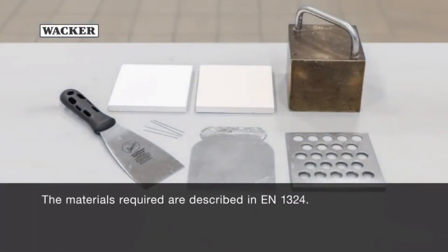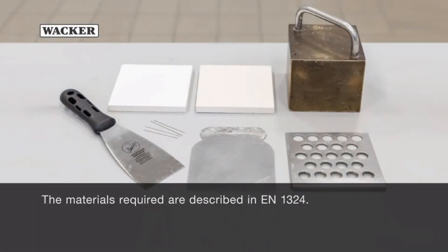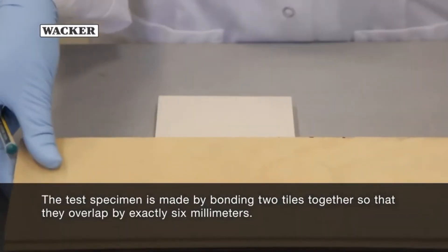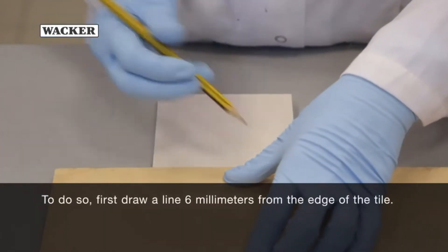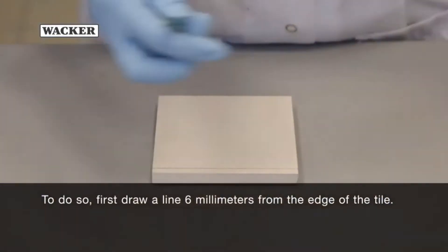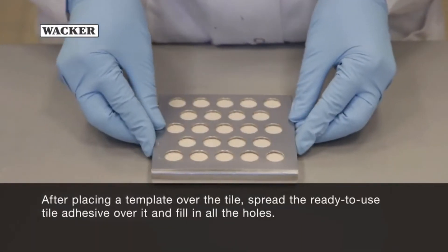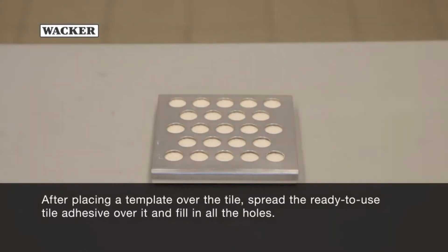The materials required are described in EN 1324. The test specimen is made by bonding two tiles together so that they overlap by exactly six millimeters. First, draw a line six millimeters from the edge of the tile. After placing a template over the tile, spread the ready-to-use tile adhesive over it and fill in all the holes.